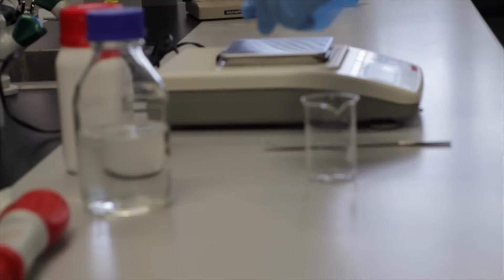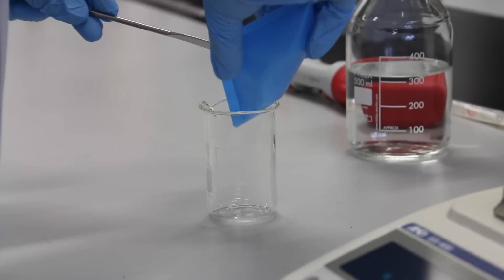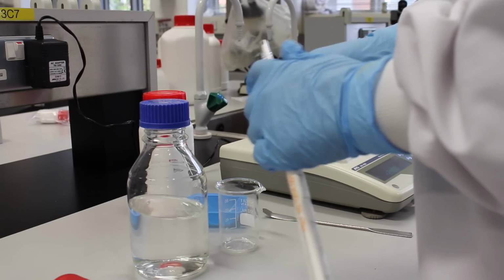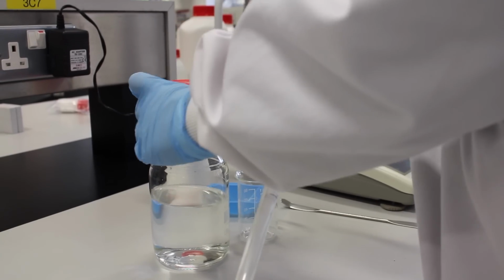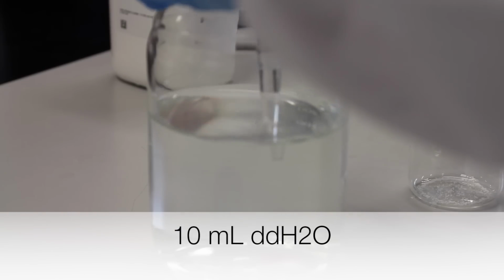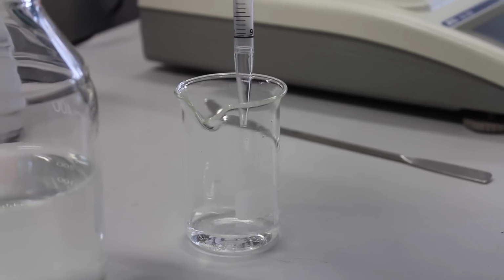The appropriate amount of salt is then added to a beaker. It is good practice to take the pipette out of its packaging only when you are ready to pipette. Water is now added to dissolve the salt. In this case, 10 milliliters of water is added. 0.9% sodium chloride solution has now been made.